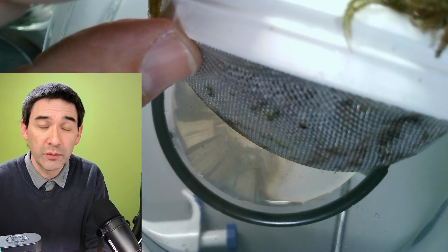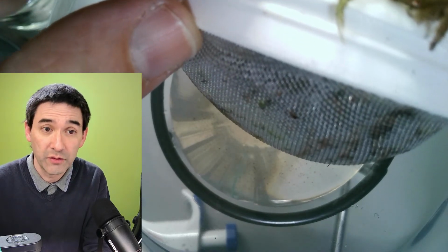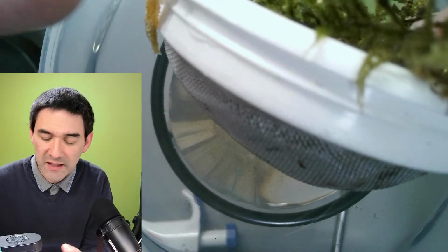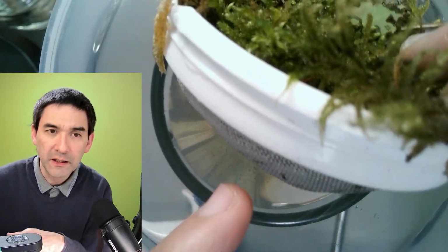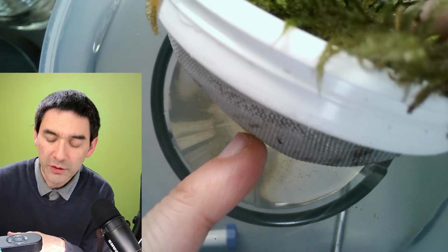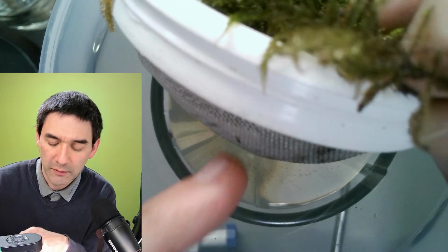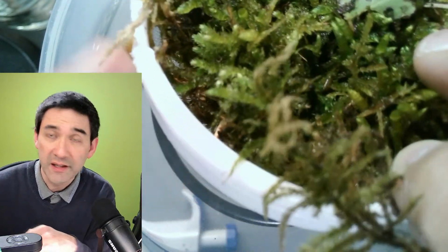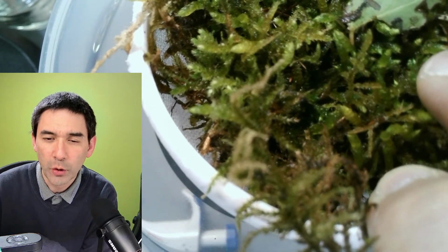This is actually the regular one that I bought in a supermarket, if you want to filter tea or juices or whatever, right? So it's really nothing unusual. I used the plastic one, or maybe it's nylon. I cut off the handles here, and that's it. So definitely not suitable for filtering water, because all of the microorganisms and tardigrades and so on are way too small to be held back. So I'm using the sieve here only to hold back the larger particles, and sand and small stones and whatever might be in here, right? So I'm just reading some of the comments again.